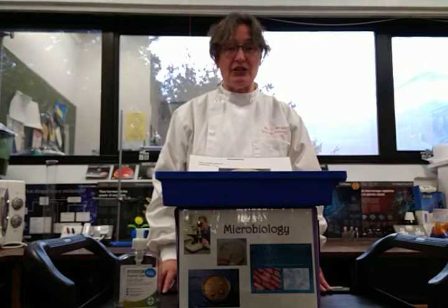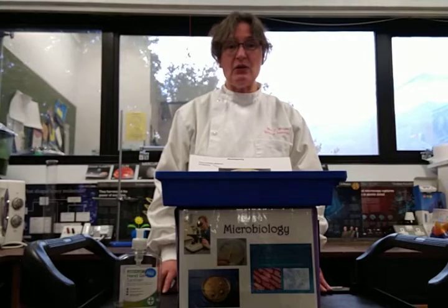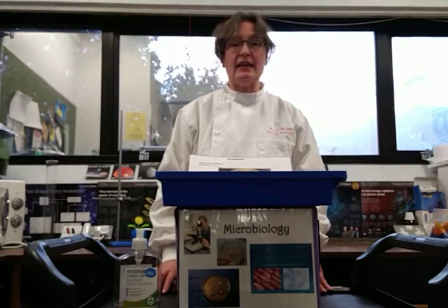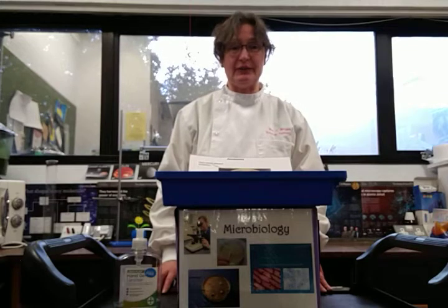So in the preparation, I disinfected my work surfaces and I sterilised all my instruments in the autoclave before use.